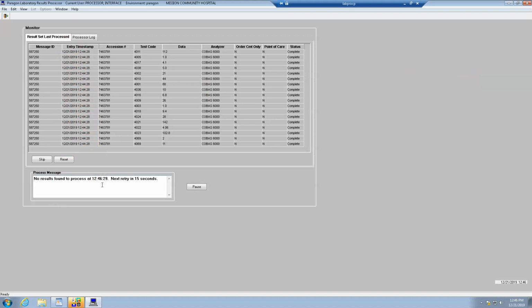You can go into Paragon. You can go into the lab application and search, but this is the easiest way to tell. So you should have results every 30 minutes to an hour, depending on the time of day. Usually overnight, every hour seems okay. Any time gap more than that is suspicious. Okay, so currently it is 12:47. Last result was at 12:44. We're okay.